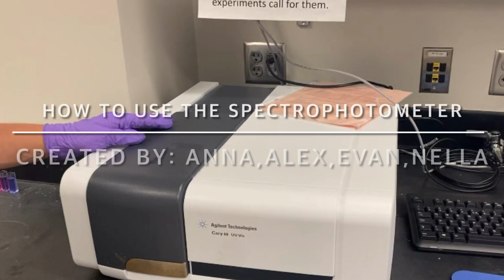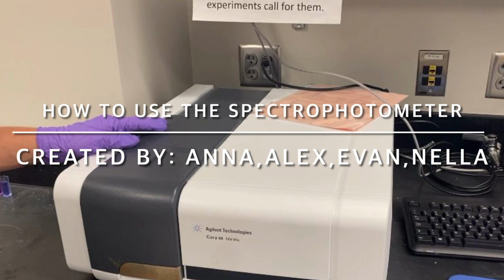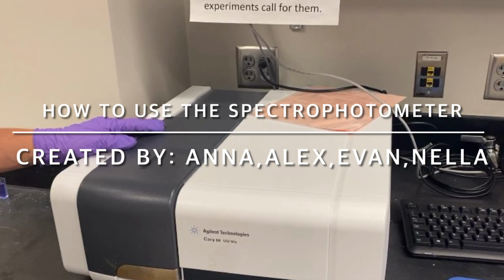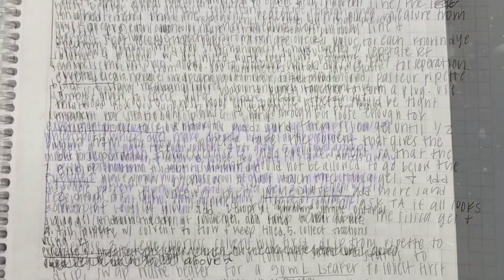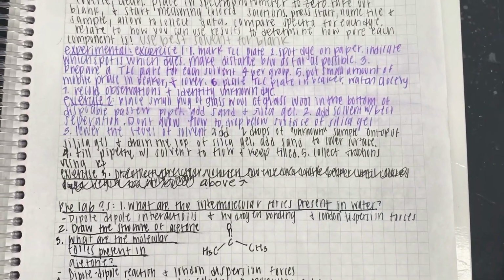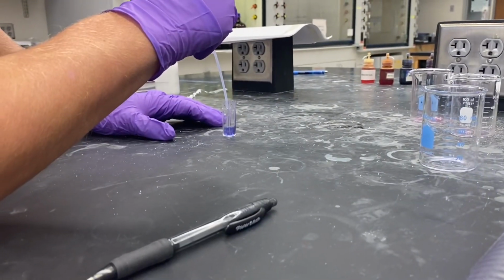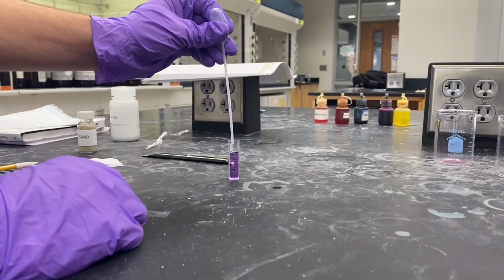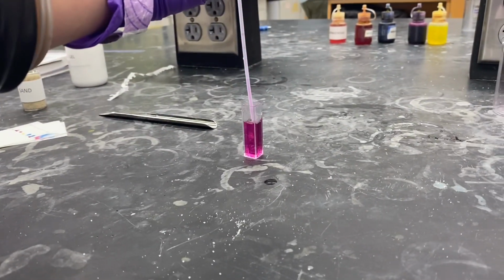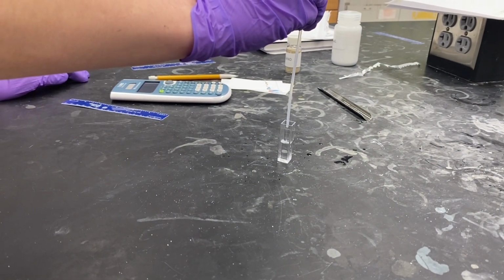Today we will be showing you how to identify purity using the spectrophotometer and the Beer-Lambert law. We will be following the steps shown in order to guide us through this experiment. First, you will fill each cuvette with colorful dye found from your unknown solvent. You will use a blank made up of acetone in order to zero your spectrophotometer.